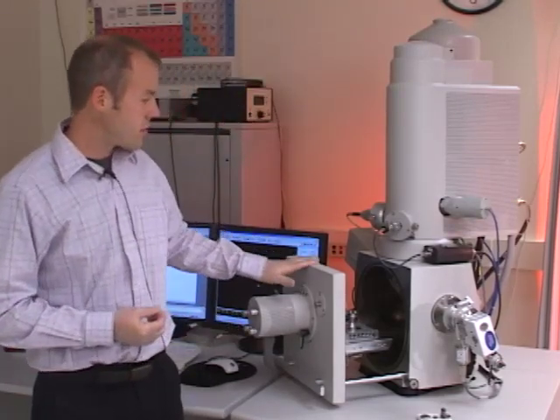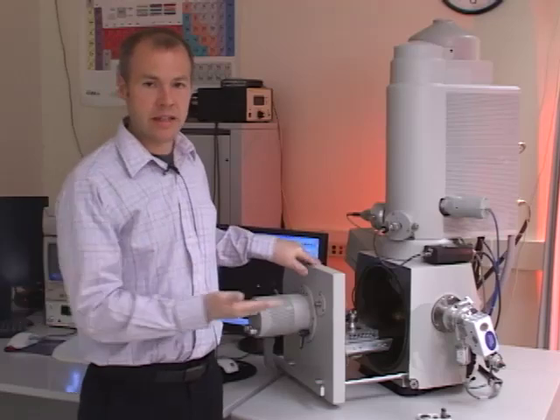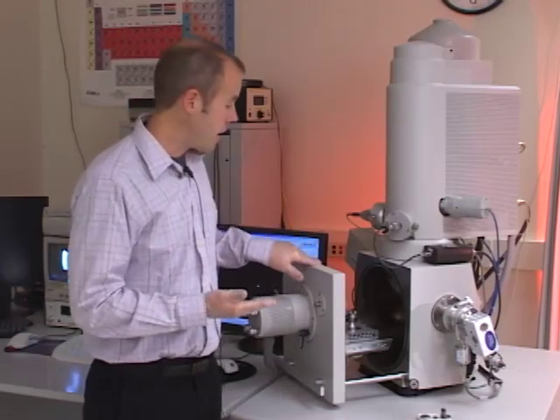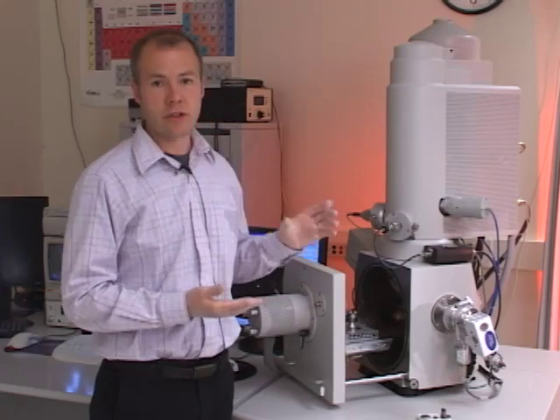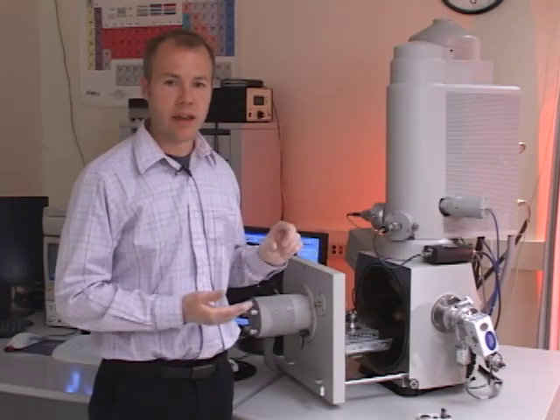When I close this chamber door, the sample is actually going to slide in underneath the detector. This chamber will accommodate a sample up to 50 millimeters in length and about 20 millimeters in height.